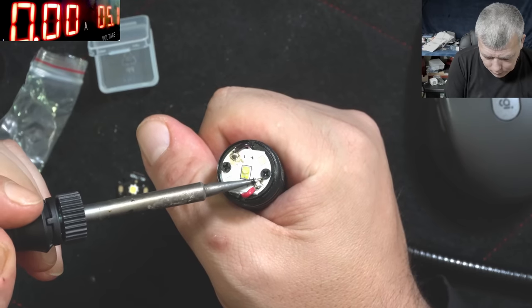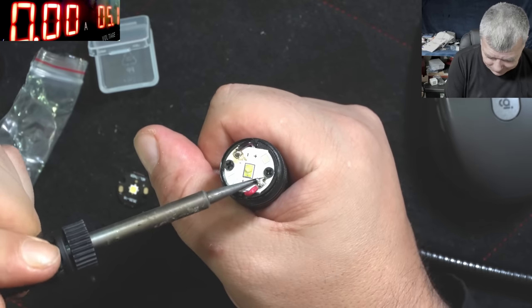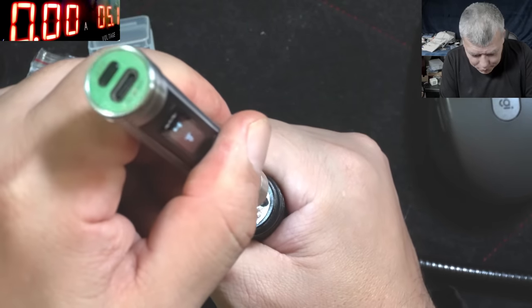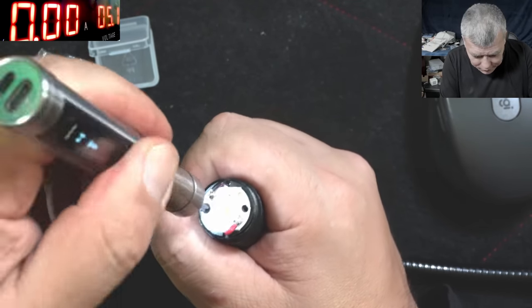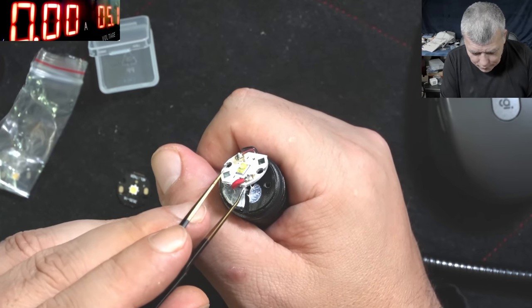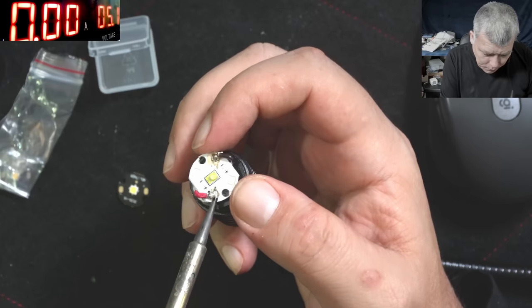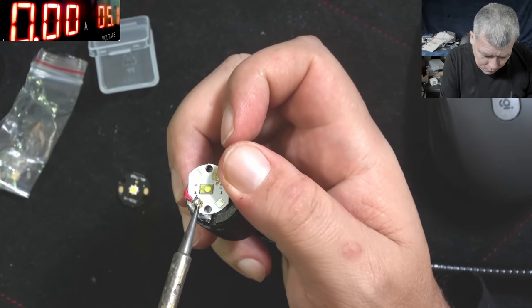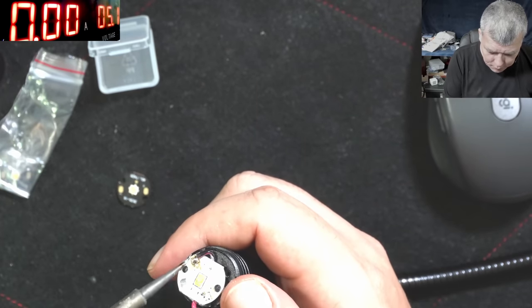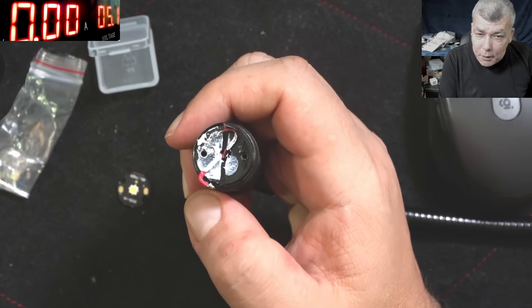Well, this is sucking the heat badly. I can't remove it easily — maybe if I open the screws. This is worse compared with a motherboard; I can feel the heat from the soldering iron on the metal. And they have thermal paste — okay, that's crazy. Finally got it out. So this is plus and that's minus. You can see they have thermal paste there.